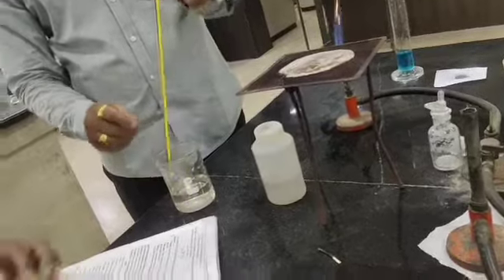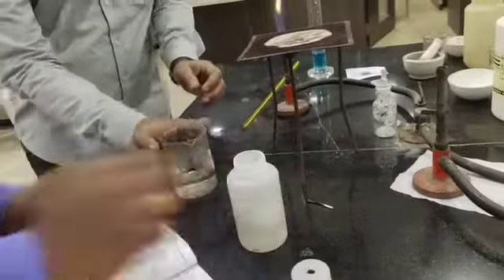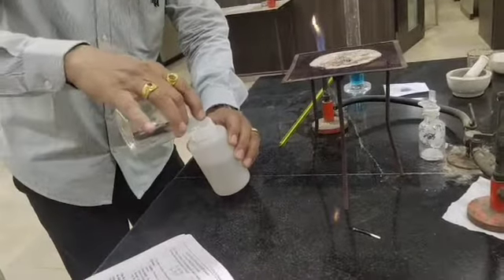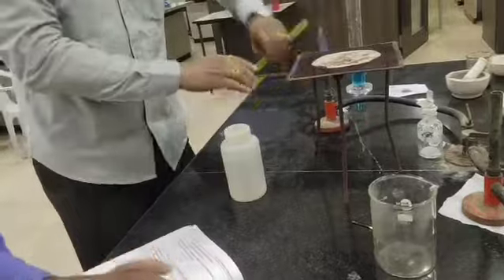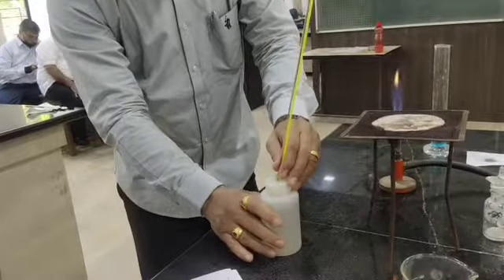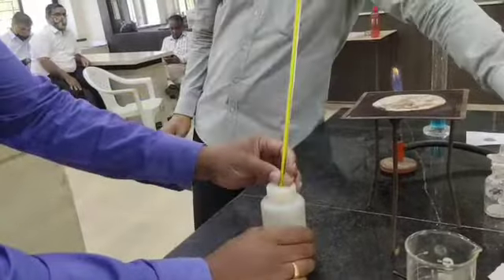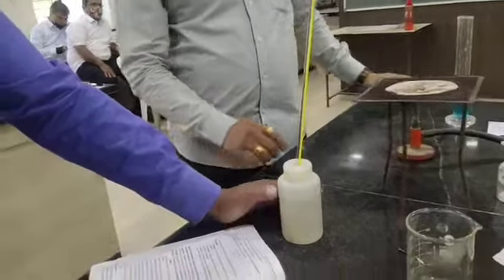The temperature becomes 63.3 degrees Celsius. As soon as you measure the temperature, you have to immediately transfer the hot water into the cold water. So our T2 here is 63.3 degrees Celsius. When we mix it, stir this solution and wait for some time. So what will happen: we had initially the cold water, and we added the hot water.